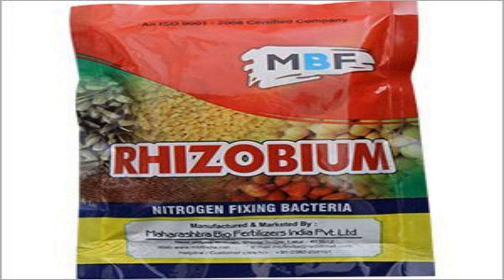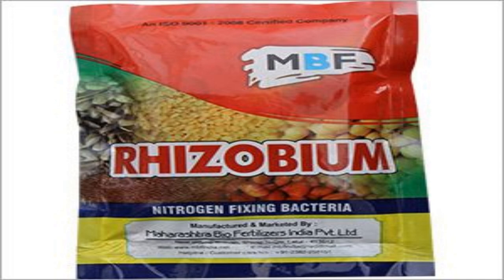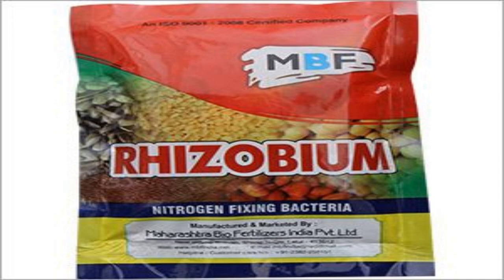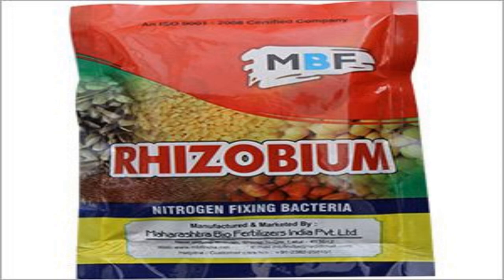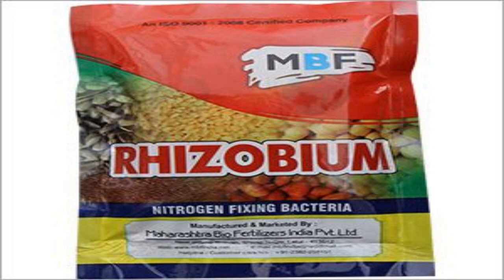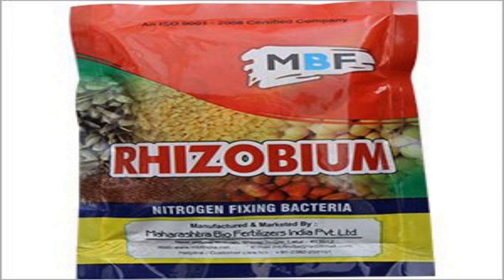Usually the biofertilizer packets are kept at constant room temperature for about a week before storage. During this time, the rhizobia grow by consuming a small amount of media present in the carrier.